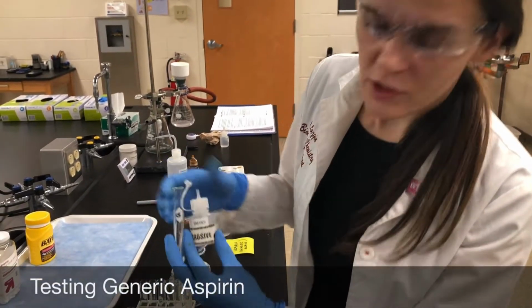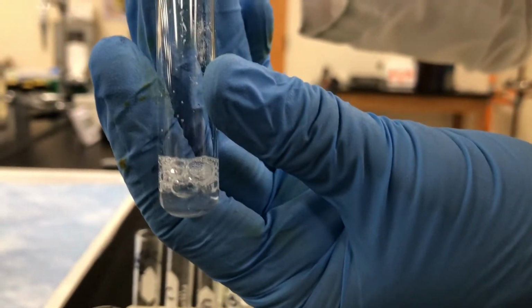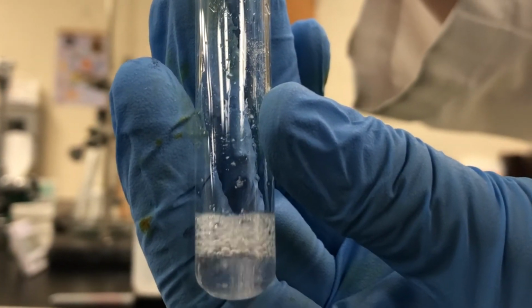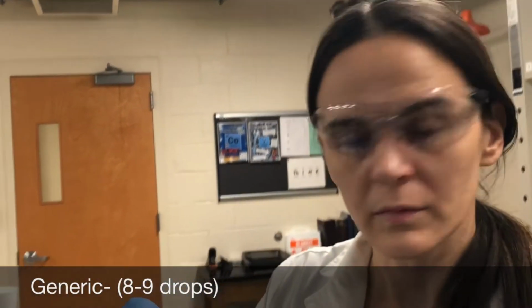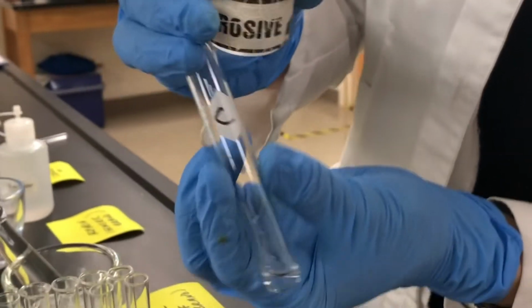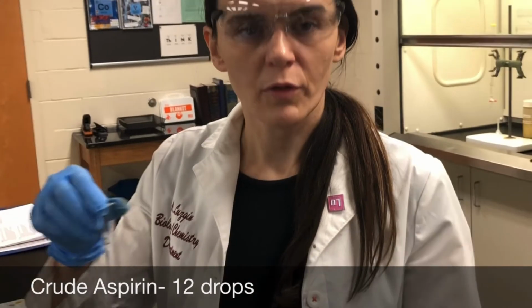Now we're going to test the generic aspirin. This one was about 8 to 9 drops. All right, and let's check the last one, which is the crude aspirin, the one that I have prepared. I would say this one took about 12 drops for the bubbling to stop.